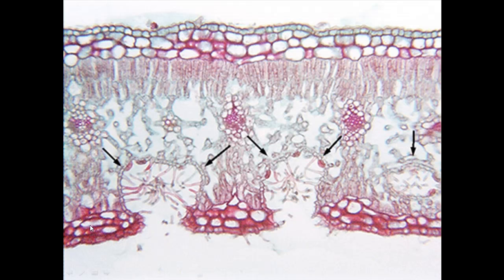So possibly down here, a bit of collenchyma again, a bit of reinforcement, not 100% sure, once again could still just be parenchyma. It can be a little bit difficult to tell. I mean, we're looking for a difference in the thickening, how thick the cell wall is. Not so apparent. So again, I'd just stick with the things I know. I'd label a vein, possibly xylem, phloem, epidermis, palisade, spongy mesophyll, and that'd probably be enough. Alright, that's it.